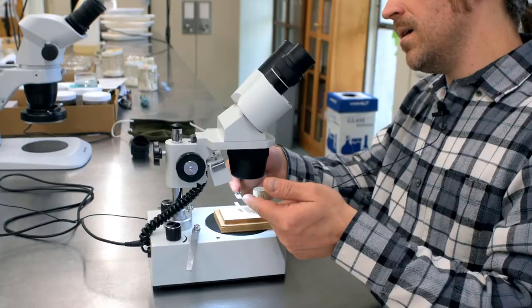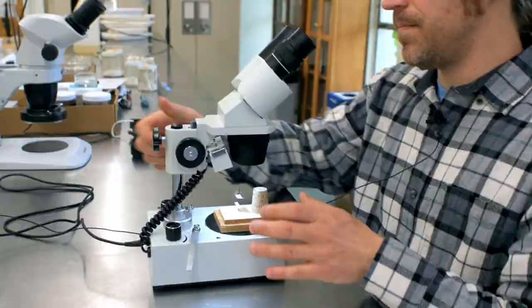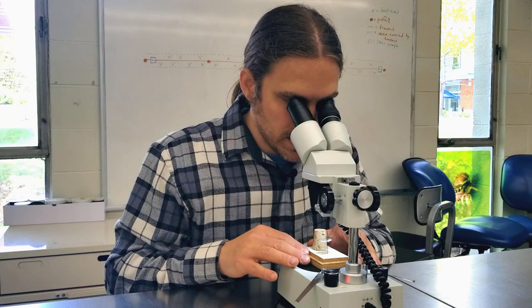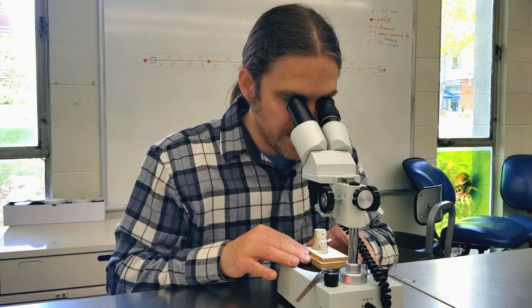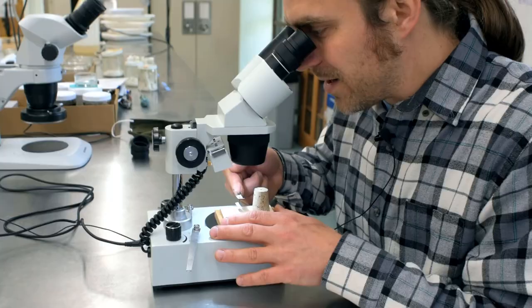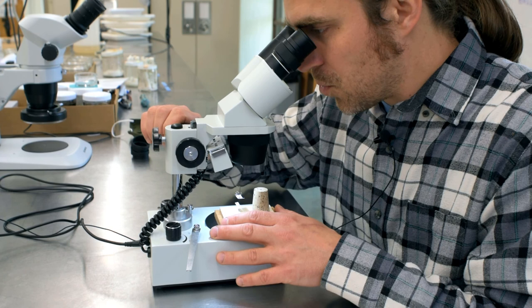The other thing I notice is that the head of the microscope is very close to the bee, so we go ahead and raise the head of the microscope up. Now that should be about right. I'll look through here and move the bee around until I see it — and there I found it. The bee is not in focus; I can see the label quite well, but the bee itself is fuzzy. So I'll come to the coarse adjusting knob and turn it, raising it up until I see the bee in focus.